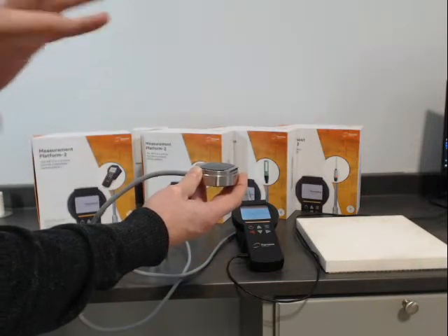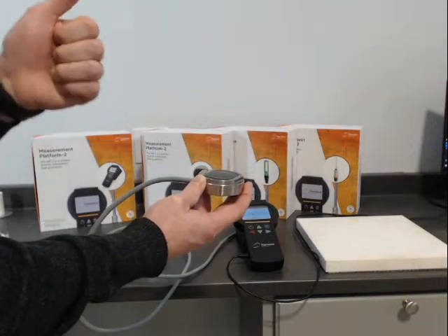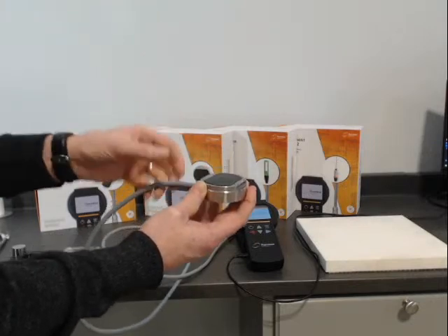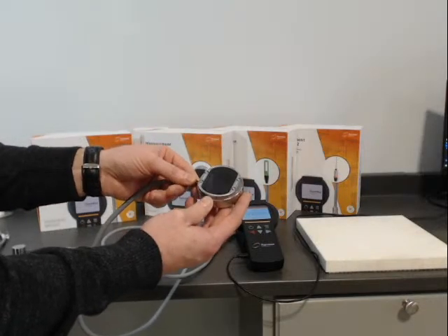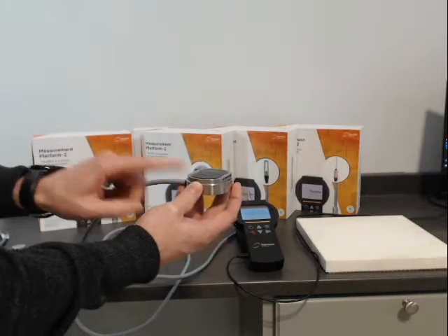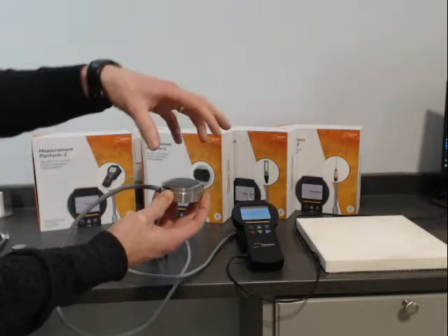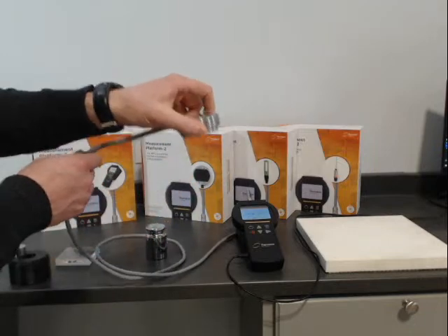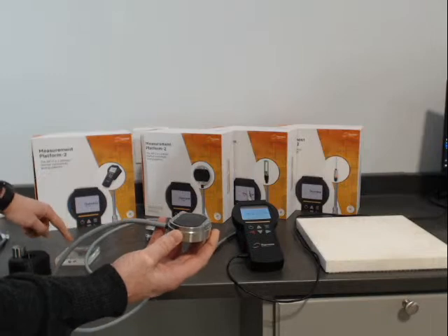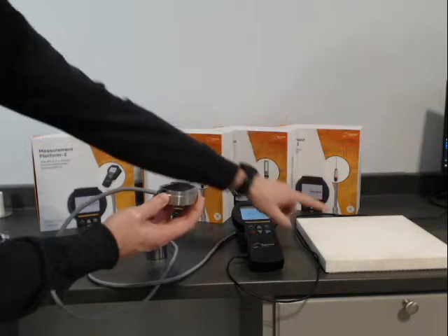Any of the transient plane source methods we have at lab scale can all be run in symmetric, two-sided — which is typical or standard — and asymmetric or single-sided. This is just a permanent single-sided sensor available on the MP2. The thermal conductivity range is 0.03 to 5 watts per meter Kelvin. It can be used with sample on top, or inverted with sensor on top of sample. Today we'll do a demonstration on the measurement of Pyrex in this configuration, and we'll show you when it's inverted and measured on a bigger sample.